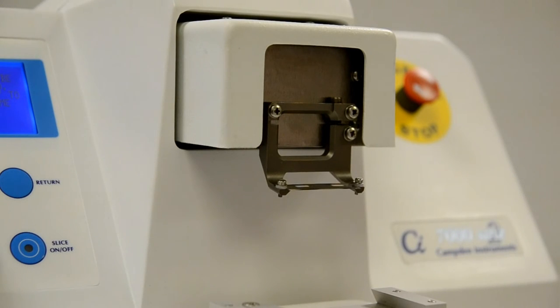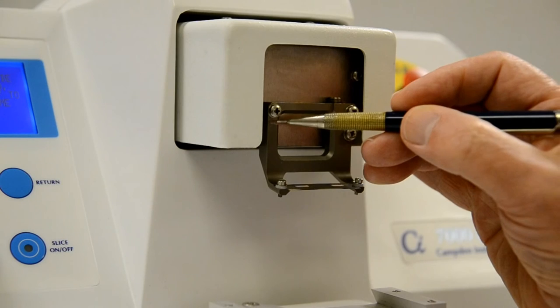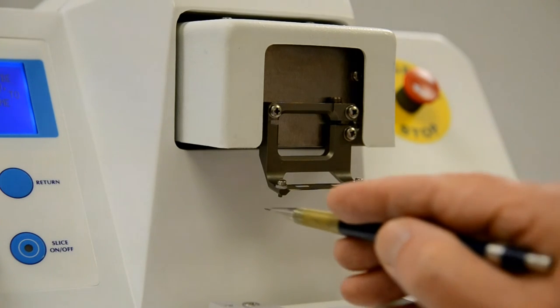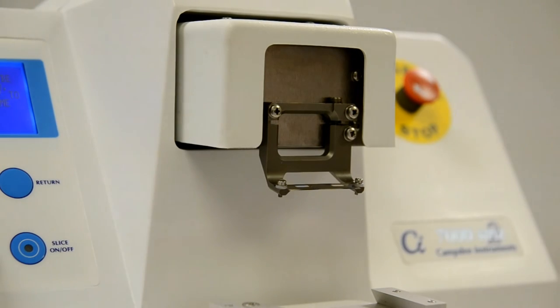There are inevitable small manufacturing variations in all mechanical components such as the blade holder, the mounting arrangement, and even the blade itself. These all combine to make fitting the blade so that its edge is in perfect alignment with the lateral vibration axis very difficult. To minimize trauma to the specimen, the cutting edge of the blade should be aligned as closely as possible with the lateral vibration axis.